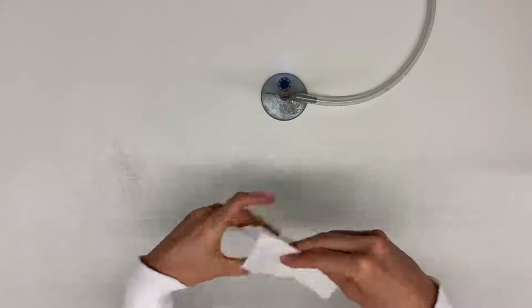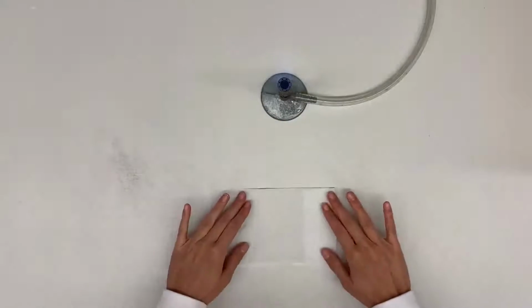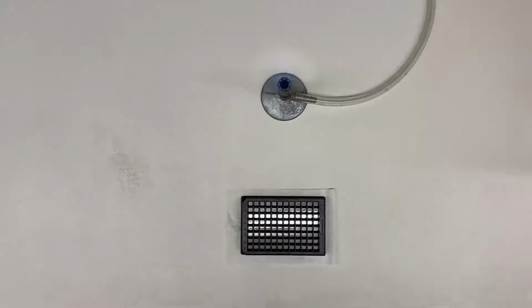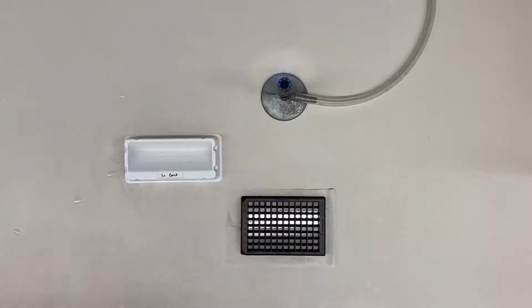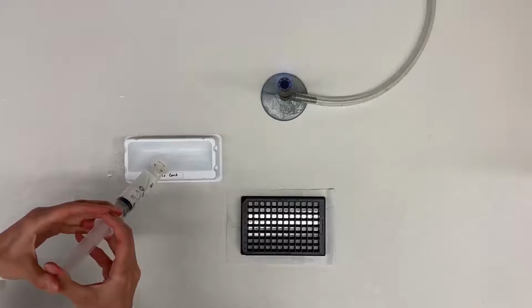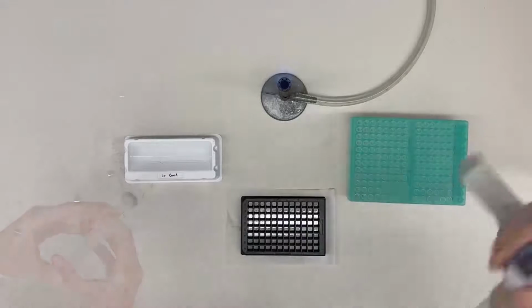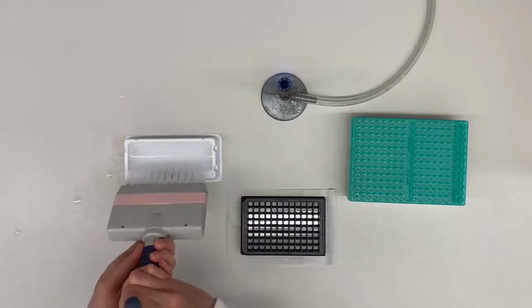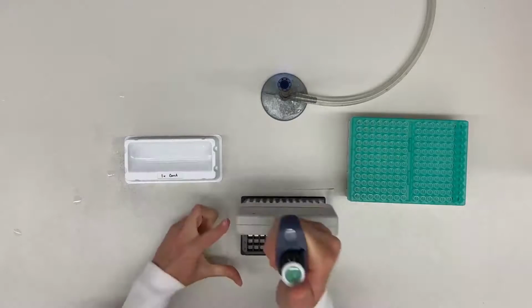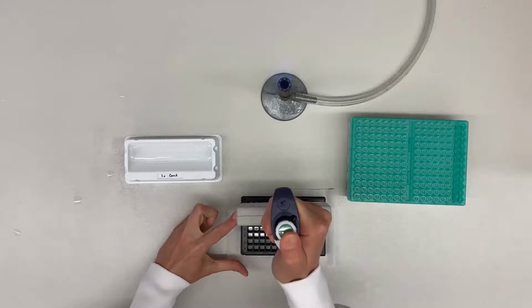Next, prepare the microscope plate. In order to keep the glass surface of the wells clear of debris and scratches, always keep a lint and static-free wipe underneath the plate. Use sterile technique on a sterilized bench. Filter 25 milliliters of 1x concanavalin A solution and pipette 200 microliters into each well of the microscope plate. We recommend stabilizing the pipette to ensure proper height.